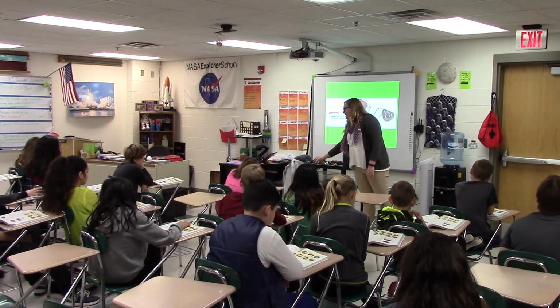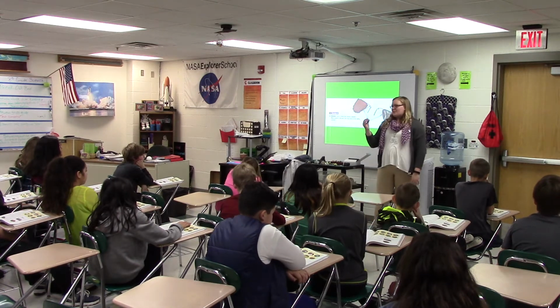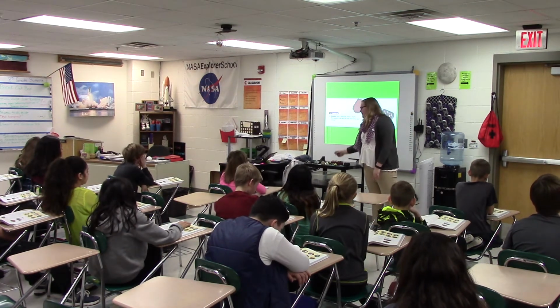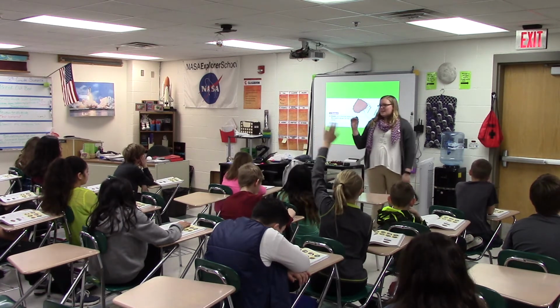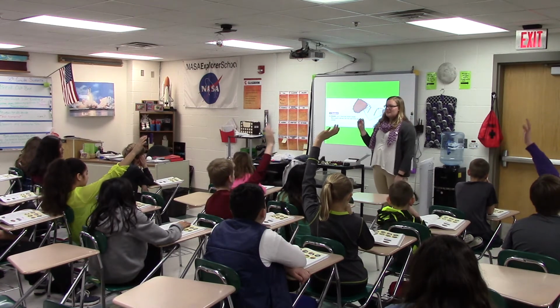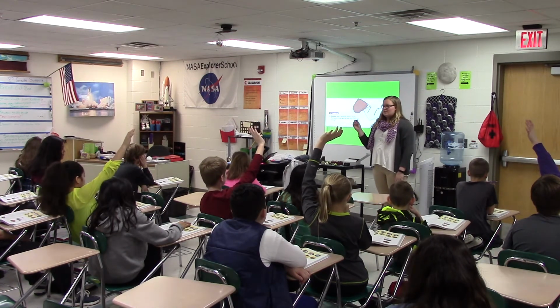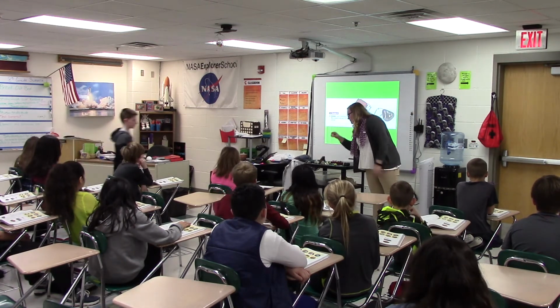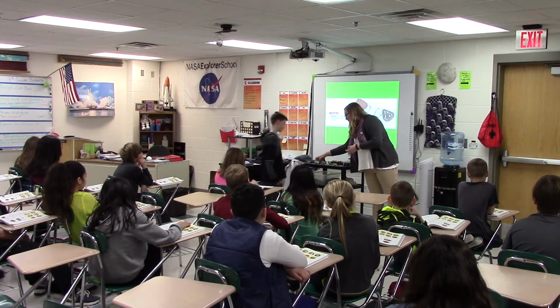So we tested with our white porcelain plate. How about we test this mineral right here? Someone want to come up here and try that for me? Luke? Do it on the white one first.